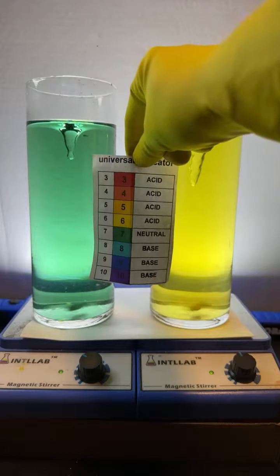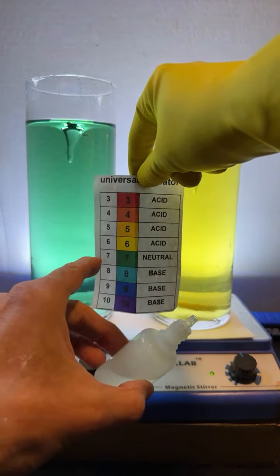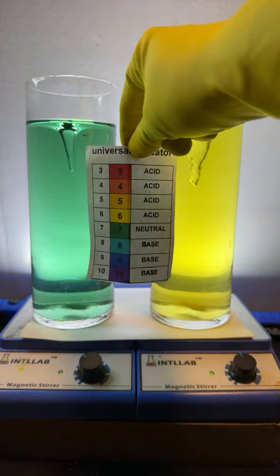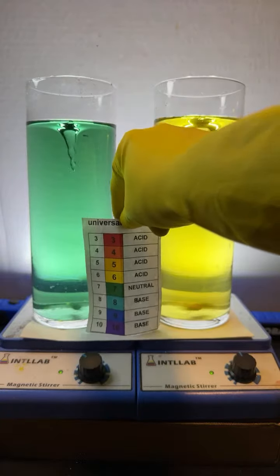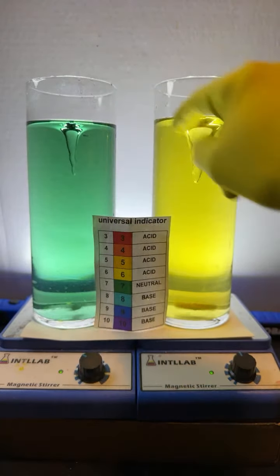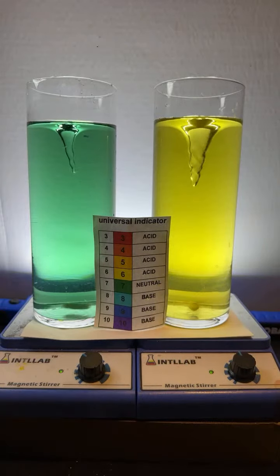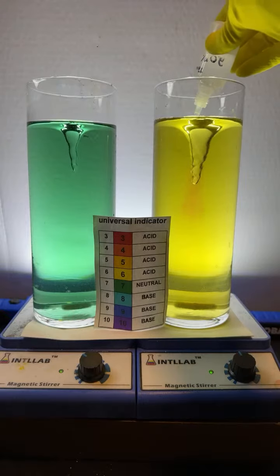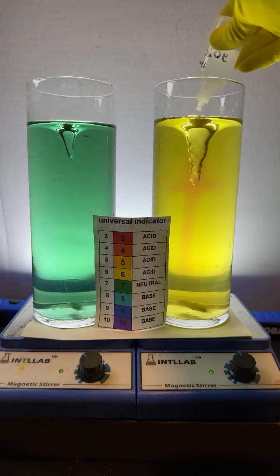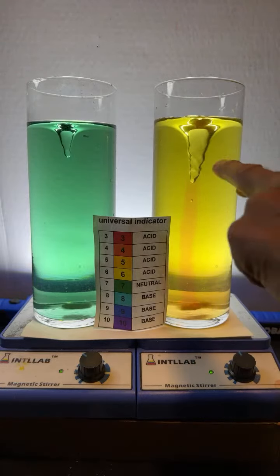You can see this flask over here is neutral because it's green, and that green tells us it's pH 7. pH 7 on the pH scale is neutral. Over here in this flask, it's yellow, so that tells us it's pH 6. Now watch what happens when I start adding some acid to the flask over here on the right. You can see it up here at the top. I'm starting to add acid, and you see the red color develop in the center of the vortex where the acid gets added.